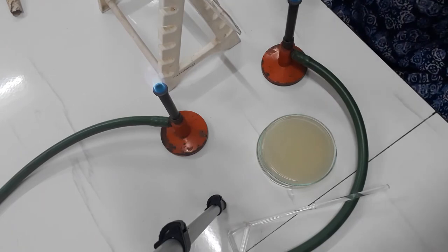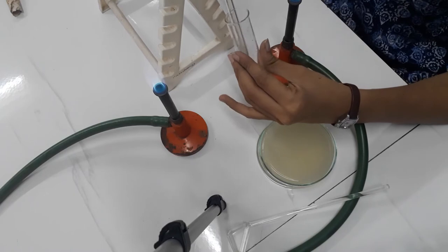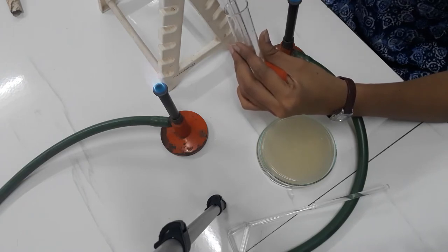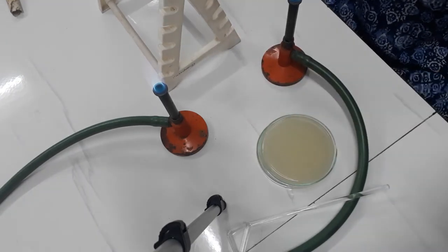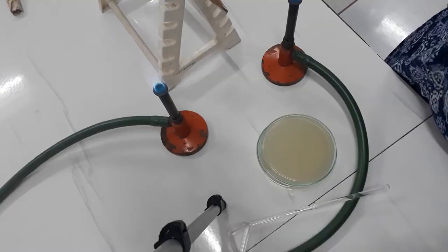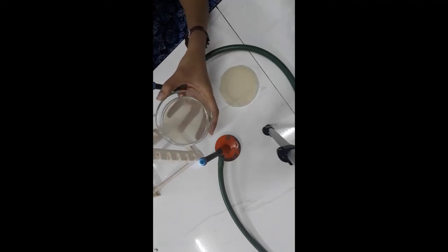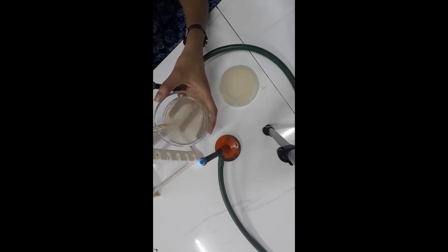The next step is to take 1 ml of the water. So now we will be doing a spread plate technique for the crowded plate method. Taking 1 ml of the clear supernatant, we add it on a nutrient agar plate so that all the microorganisms will get equal chance to grow. Since the sample is a soil sample, there will be lots and lots of microorganisms present.